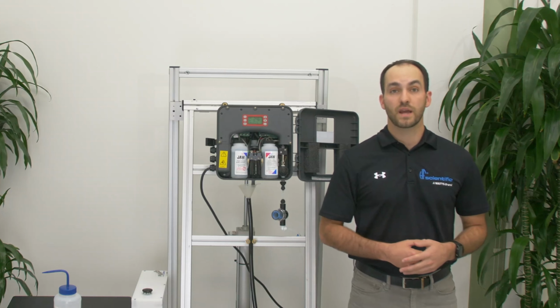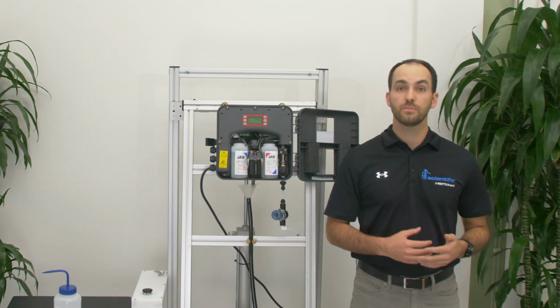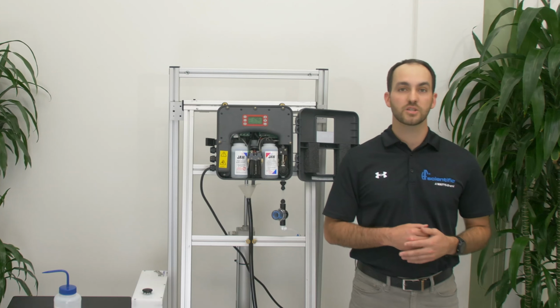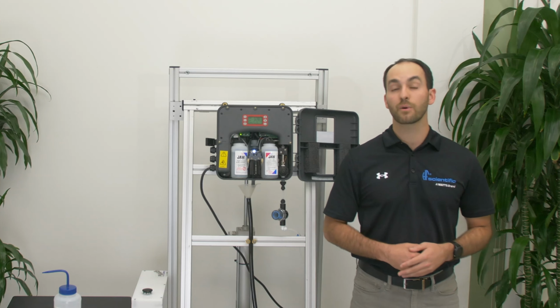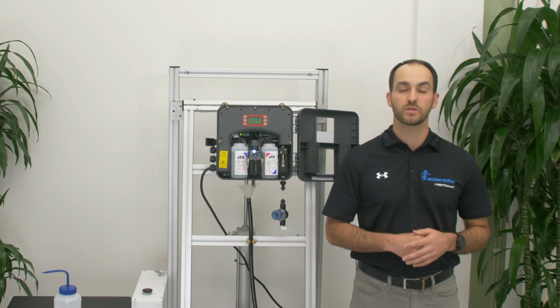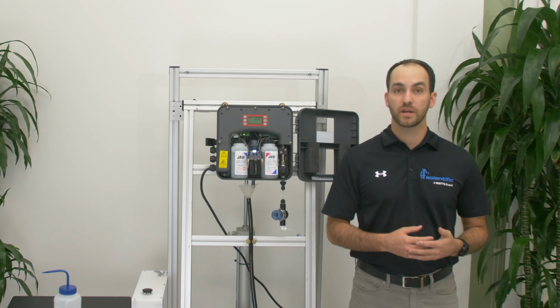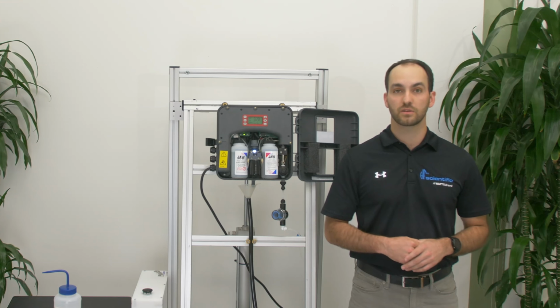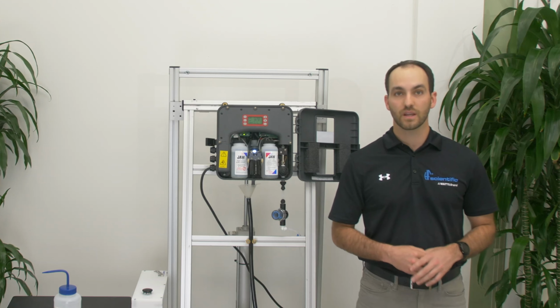The next few alarms have to do with the solenoids and could be in conjunction with the flow path errors above. The alarm SOL0 is an error with the power supply and is telling you that the analyzer cannot open the solenoids with the power provided. Check to make sure the analyzer is wired correctly. You may also have to do a power cycle to clear these alarms.